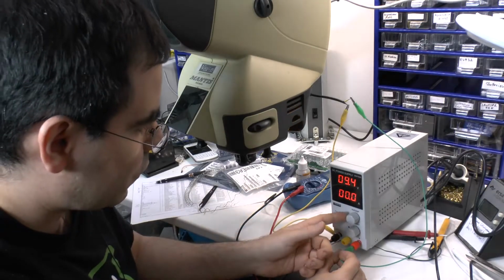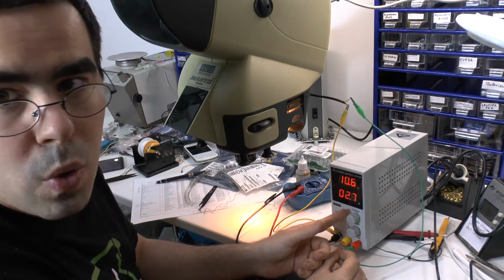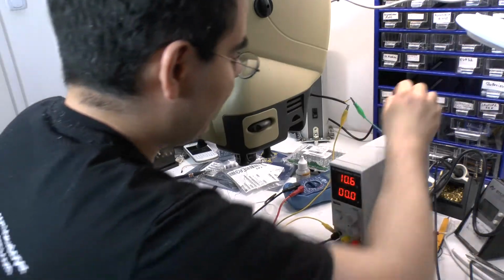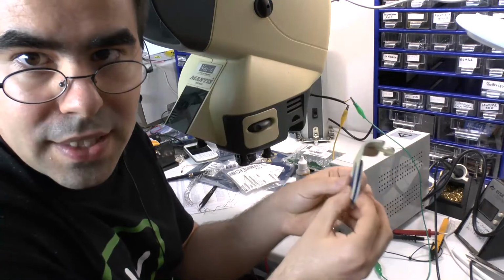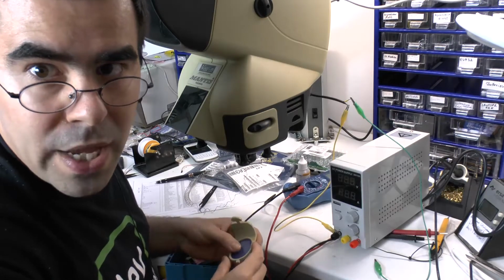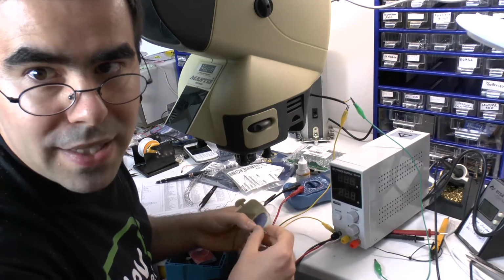So let's give it a bit of extra voltage and some more current. And we see, wow, there is some light at the bottom. I mean, what's important here is that this deflector glass here is missing. So you see the cone is very focused, while normally it's spread out. But for now, this isn't important. For now, I've got the power supply. I can put these in again and I'm back in business.